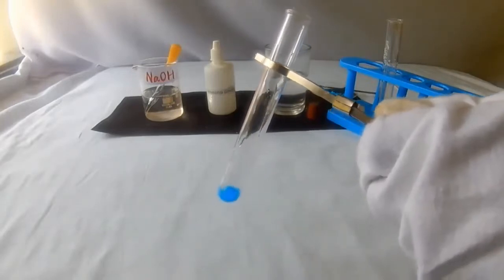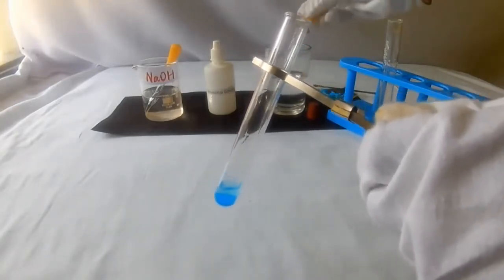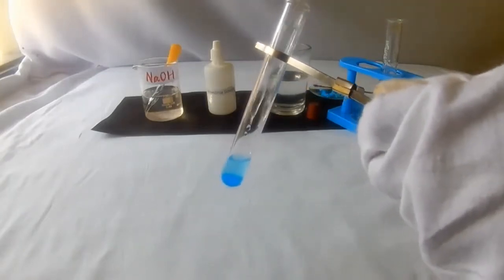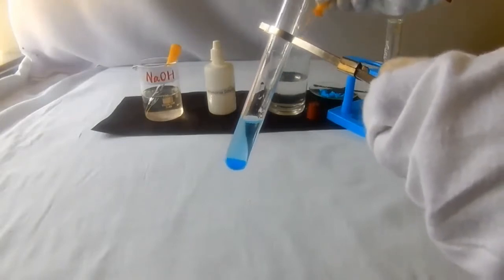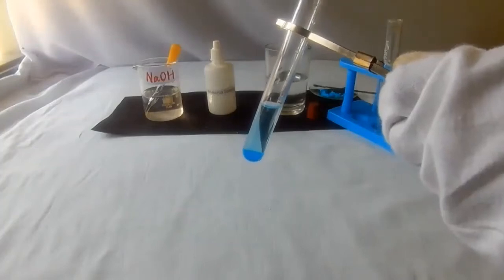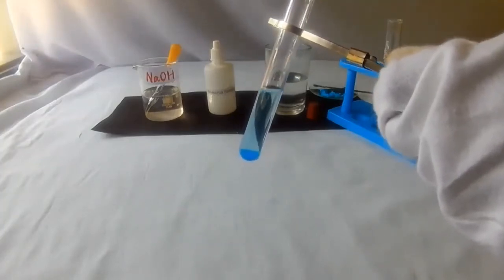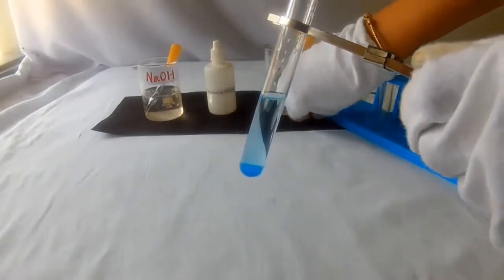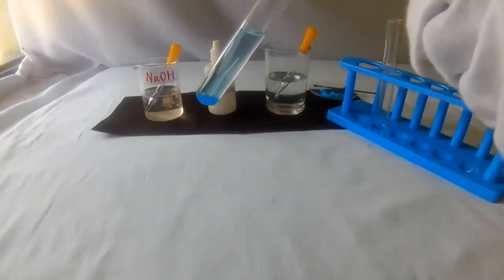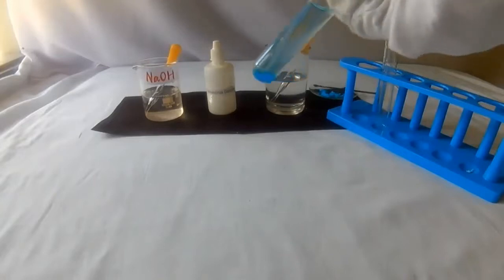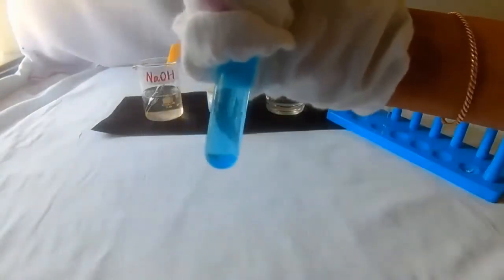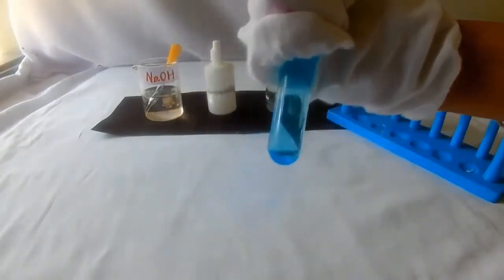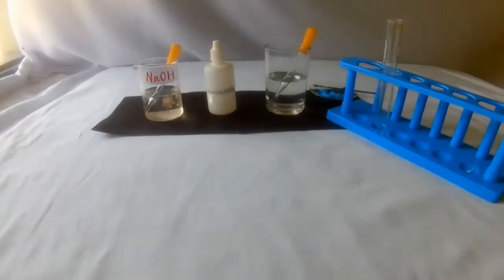Now add water to the salt. We have to prepare the solution. Close the mouth of the test tube. Shake the test tube well so that the salt dissolves in the water. Now the solution is ready.